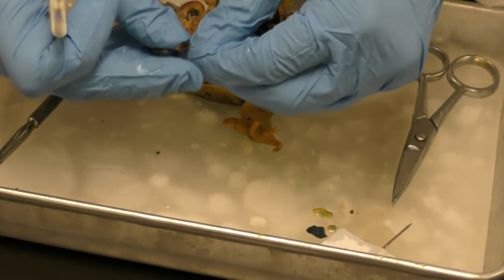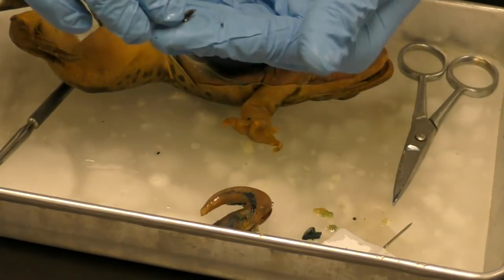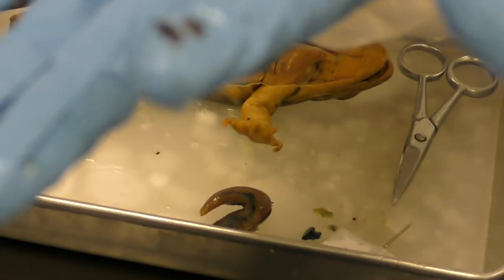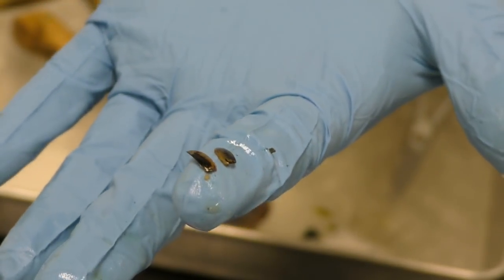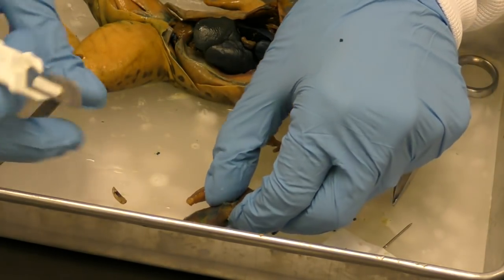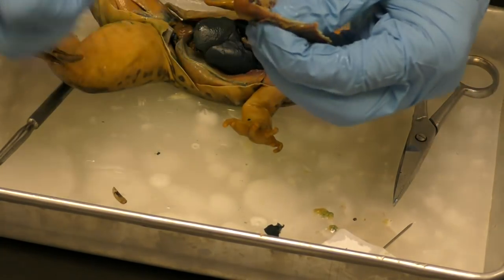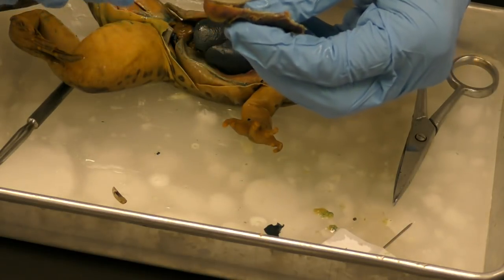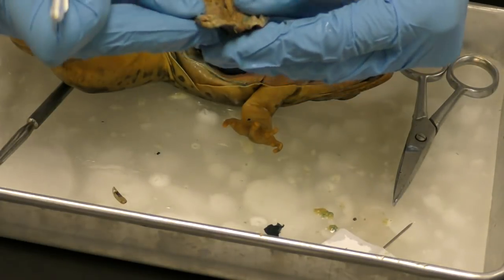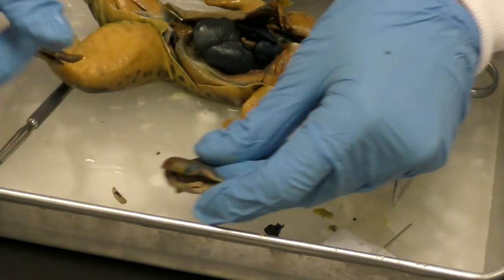Oh yeah. All right, so I found a beetle, like a little carapace. It's just the wings of the beetle. Let's see if you guys can see that. Okay, so it was intact, but then I broke it when I grabbed it out. So we've got the frog ate a little beetle. And what's that? Another little beetle part, probably more to its abdomen. And that's it, nothing more fun in there. Okay, so that's it, cool.